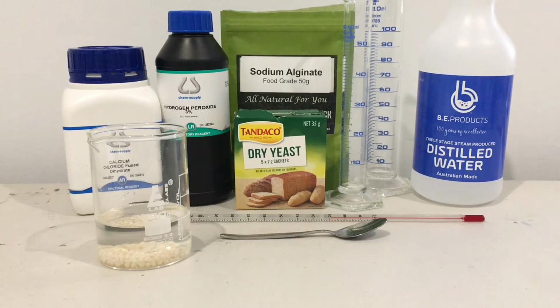Basically the test that I will run will be a concentration variation of 3 different concentrations, so 0.1, 0.2 and 0.3% hydrogen peroxide, and I'll also be running a temperature variation of 5 degrees, 20 degrees and 40 degrees, and I'll be running 5 replicates of each test. You guys can write up a table for your results and get an average for each one. And as you'll see, the following tests will come in just a sec.